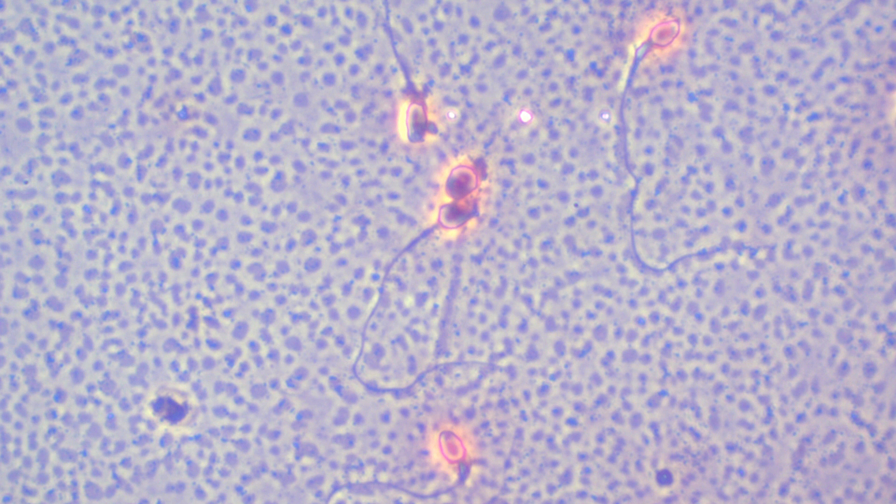My patients are always very shocked when I tell them because they think it's got to be ninety percent at least. So let's get to microscopy.